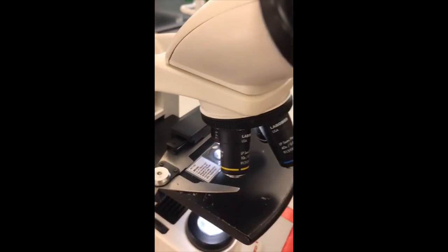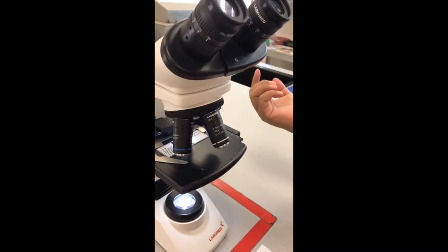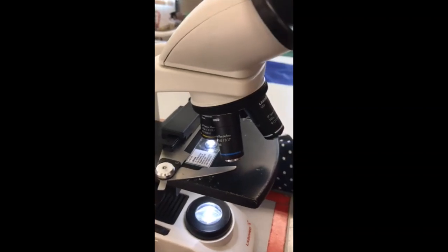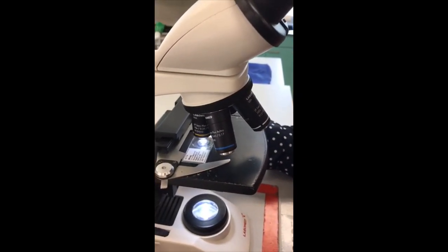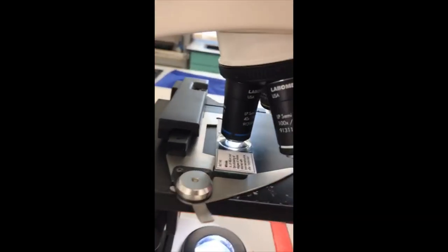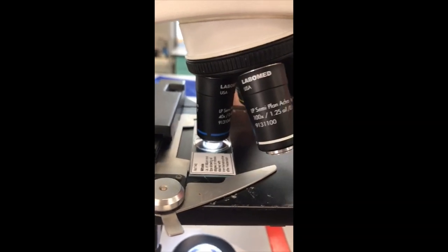So how to do that? I just switch the objective lens from 4x to 10x and adjust it again to get a sharper image using either the fine or coarse knob. Then next I switch it again to 40x. At this point you can see the objective lens is longer compared to the 10x objective lens.